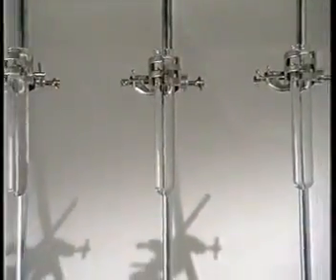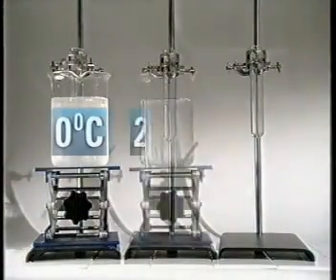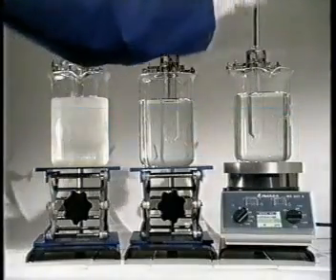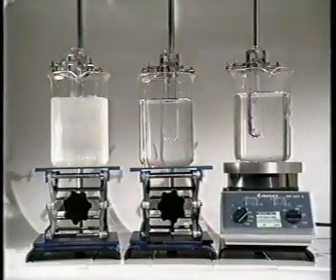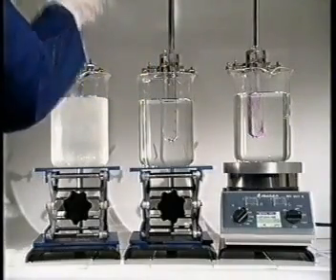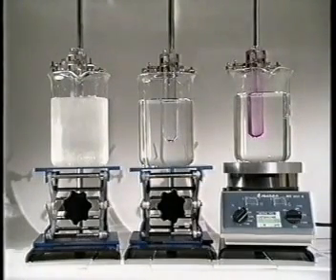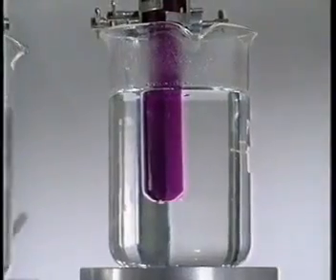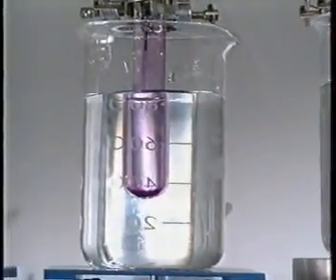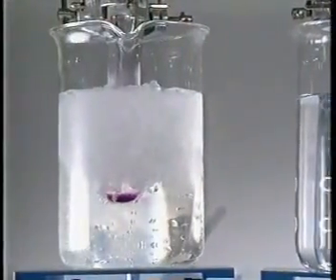These three tubes containing water are immersed in baths at different temperatures: 0, 20, and 70 degrees Celsius. A crystal of potassium permanganate is placed in each. After 10 minutes, diffusion in the hot water is almost complete.